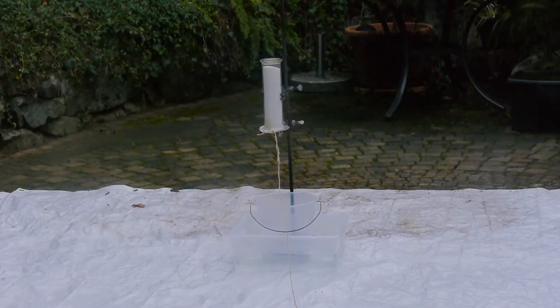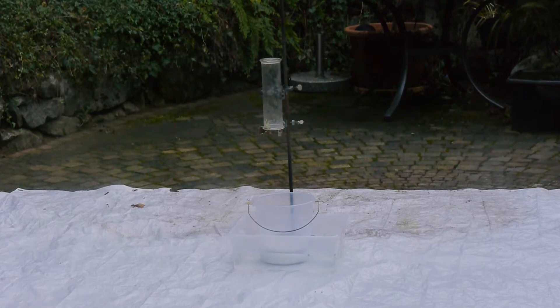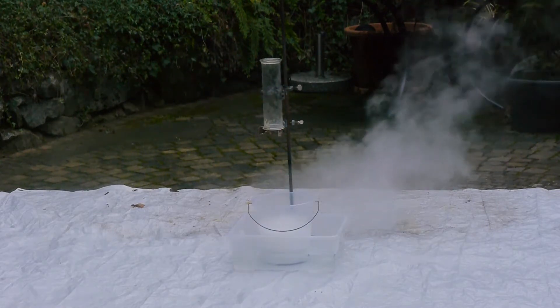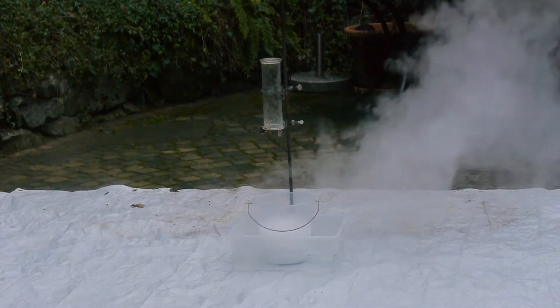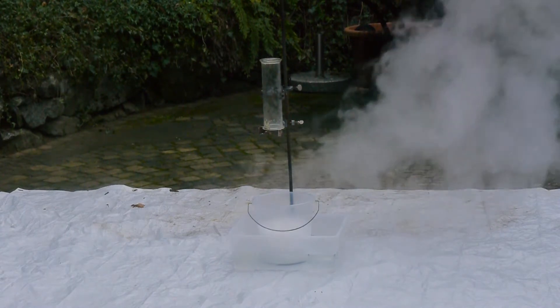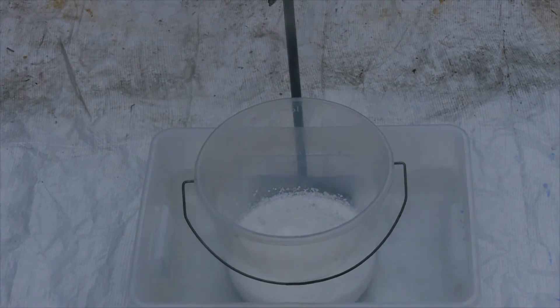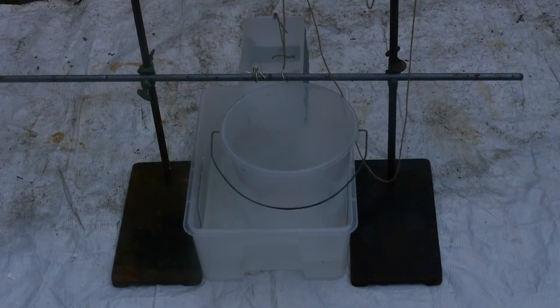Glacial acetic acid versus solid sodium hydroxide — let's go. That was quite anticlimactic and also a very delayed reaction. The bucket has gotten quite soft, and I can still smell the acetic acid like crazy. Now let's try this again with different apparatus.